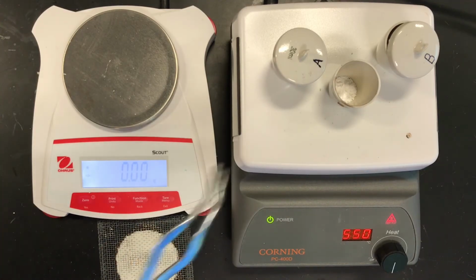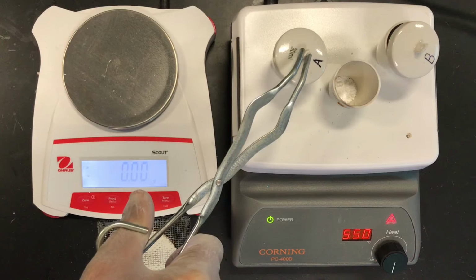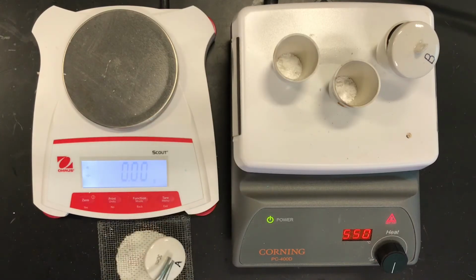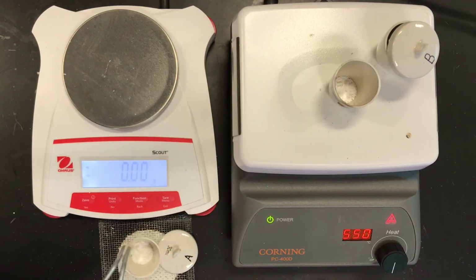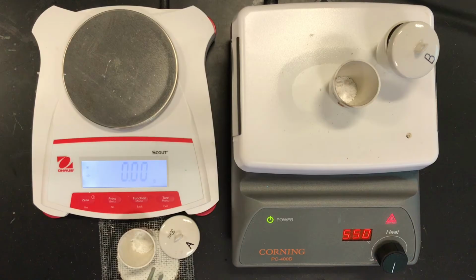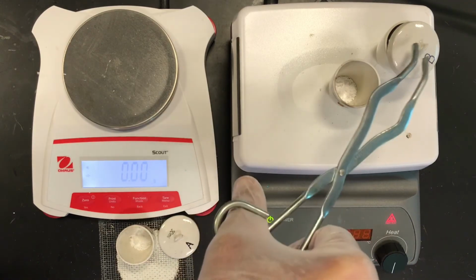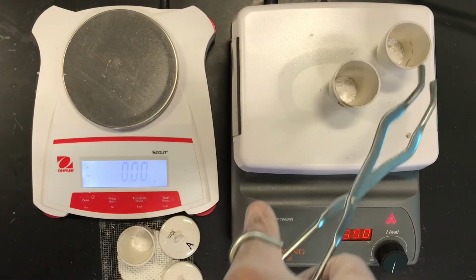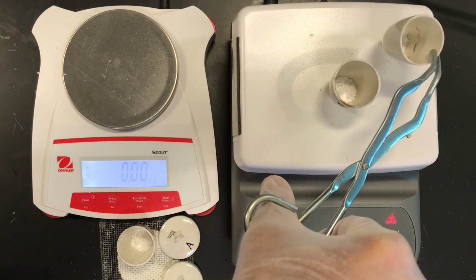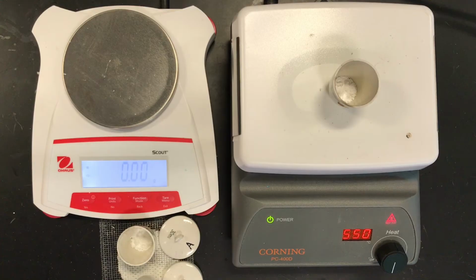In any case, let's go with A. Before we measure a crucible, we should never do so while it's hot, so we're going to take it off the heat to cool it, and we'll do the same with student B's crucible as well. I'm going to put the hot crucible on the wire gauze because the cold chemistry bench could possibly crack the crucible.